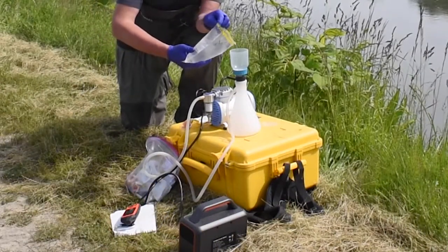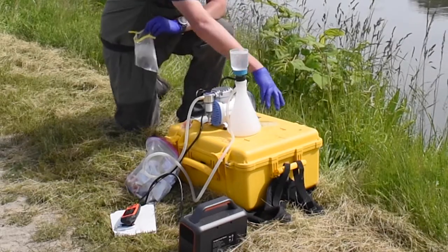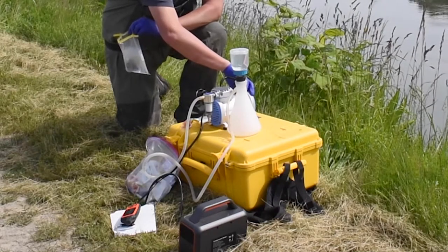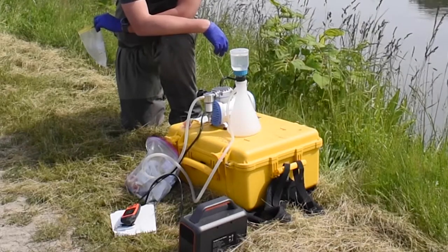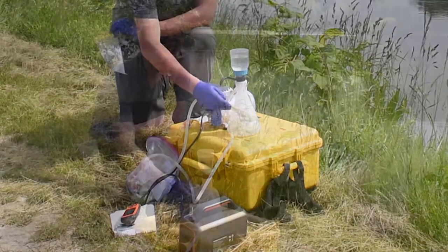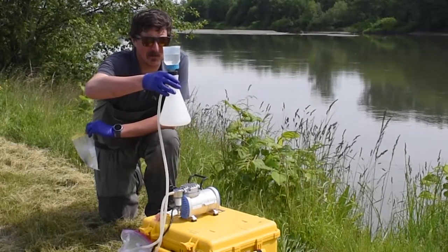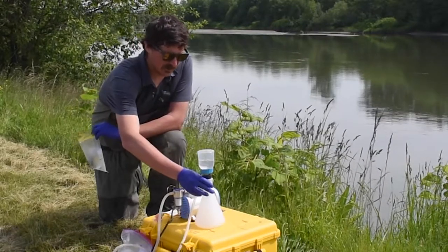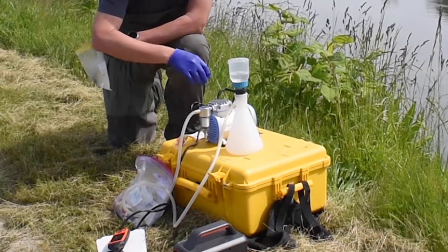So what we do is pour the water into the filter funnel, then turn on the vacuum pump. As you can see, it's a bit of a slow process — the vacuum pump is pulling air through this tube and the water is going into this beaker here.